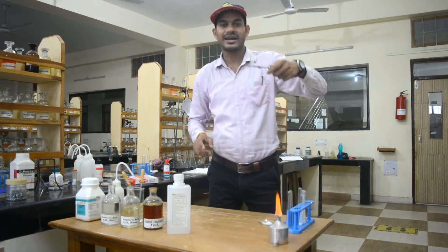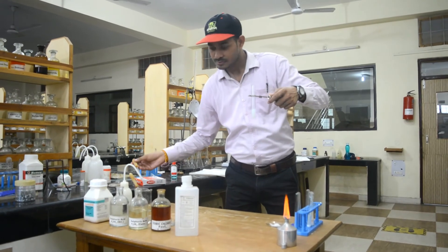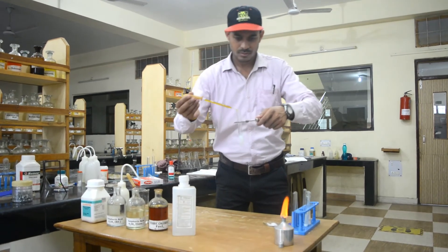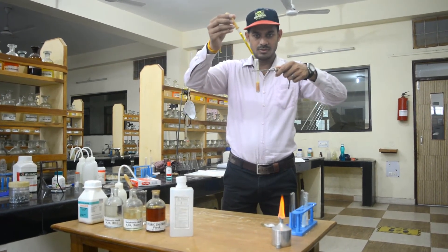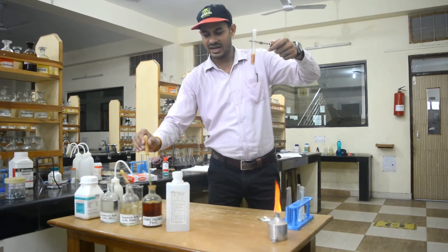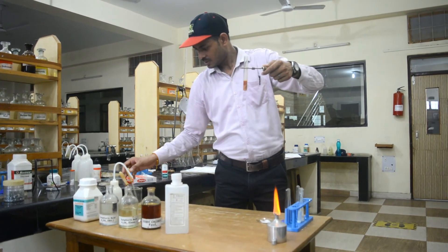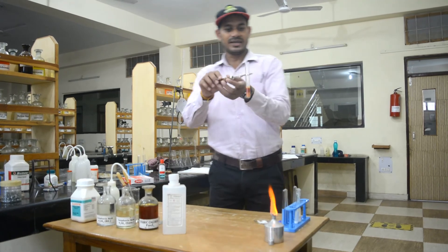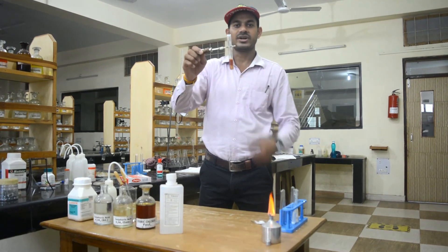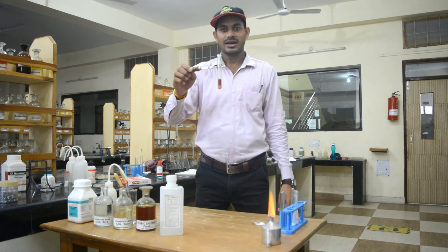I have prepared the solution. Now I will add ferric chloride. You can observe the blood red color in the solution, confirming the acetate ion. When ferric chloride reacts with the acetate ion, it forms ferric acetate, which gives a red color solution. So these are all three tests for confirming the acetate ion.